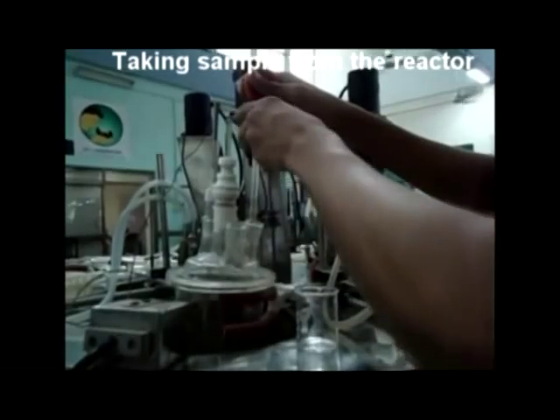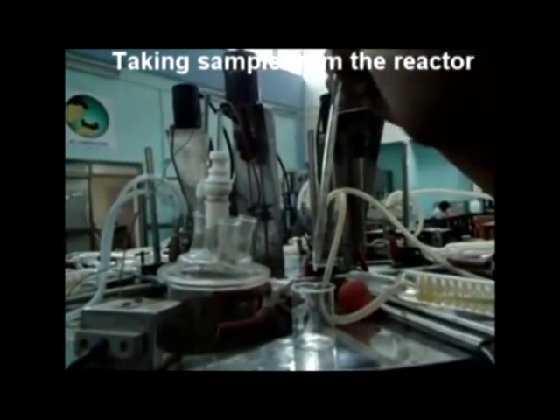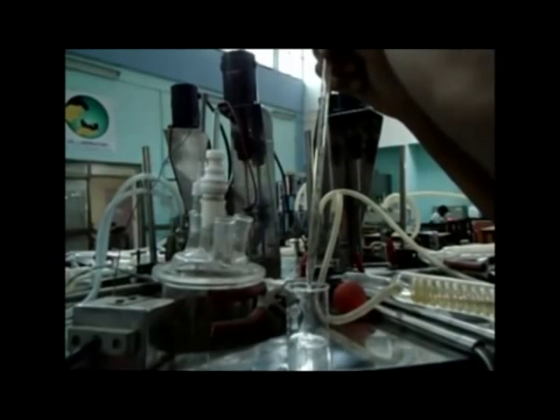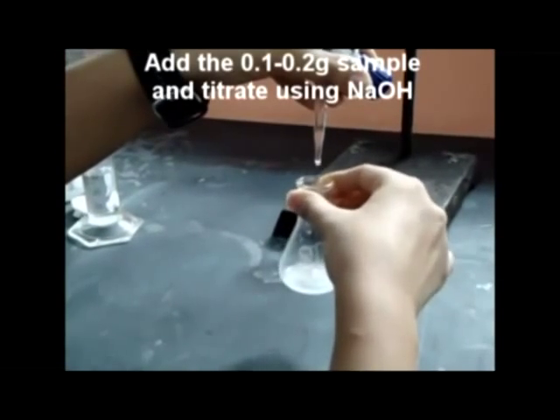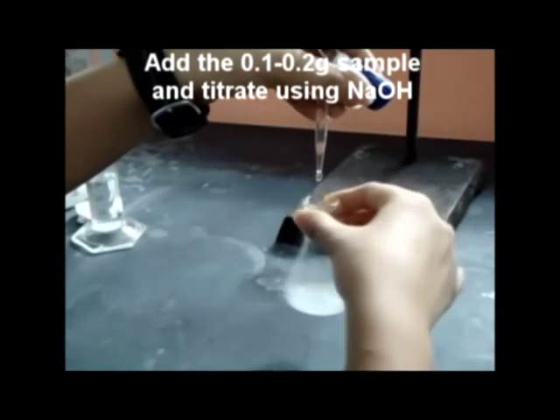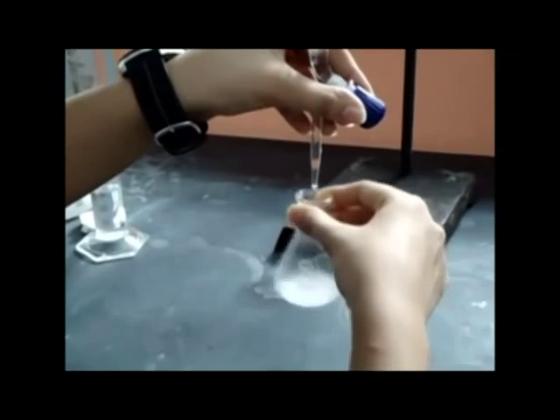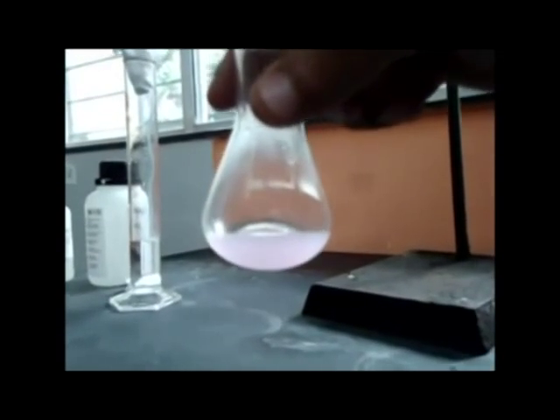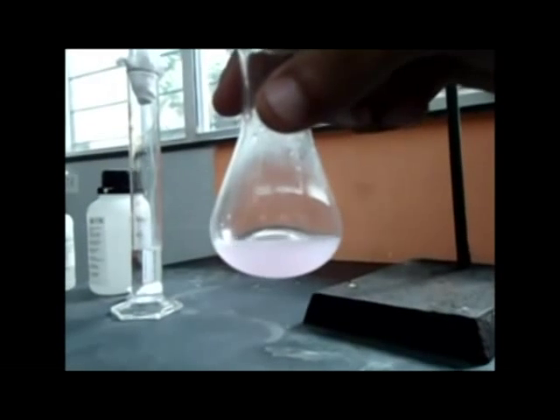Switch off the stirrer. To take a sample from the reactor, pipette out a small amount of oil and collect it in a beaker. Add about 0.1–0.2 grams of oil to the ethanol, note the exact weight of the oil carefully. A light pink color indicates the titration is complete; note down the volume of NaOH consumed.